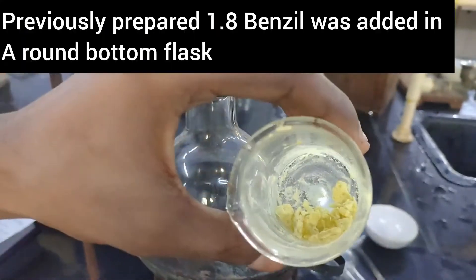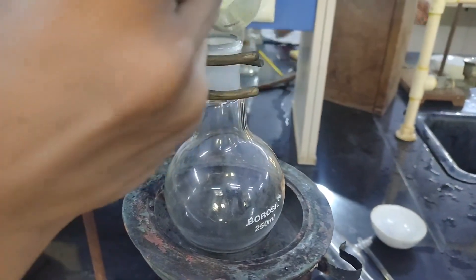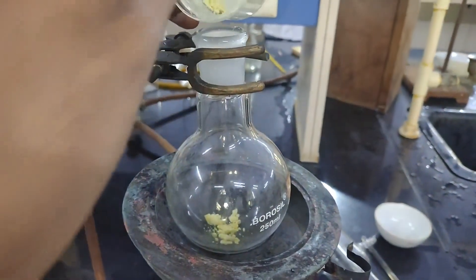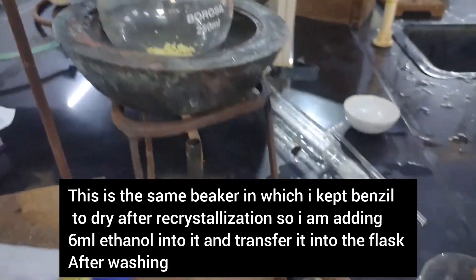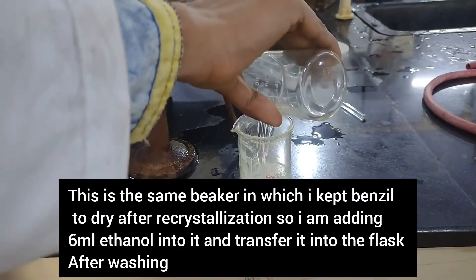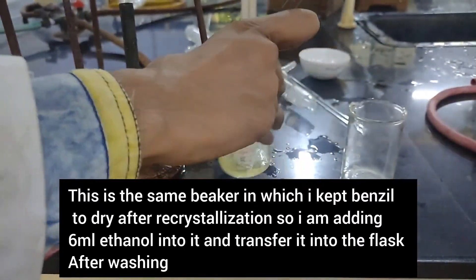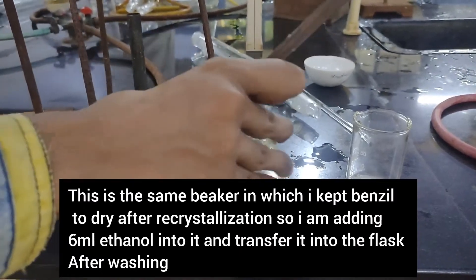Here I have 1.8 grams of benzil that I prepared in my previous video. This is added into a round bottom flask. Now to the same beaker, I am adding 6 ml of ethanol, washing it, and then transferring all the ethanol into the round bottom flask.